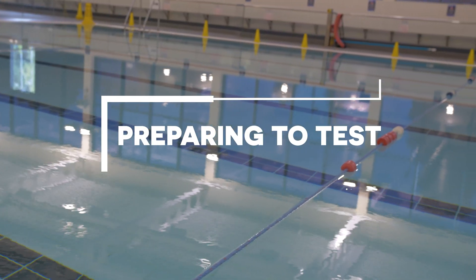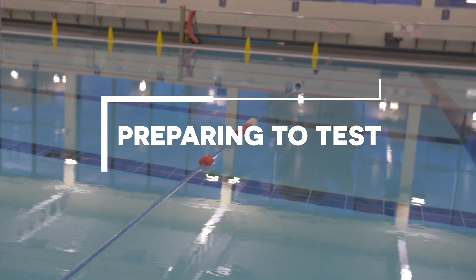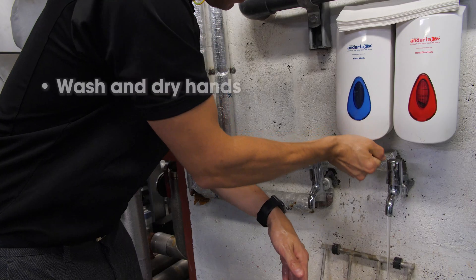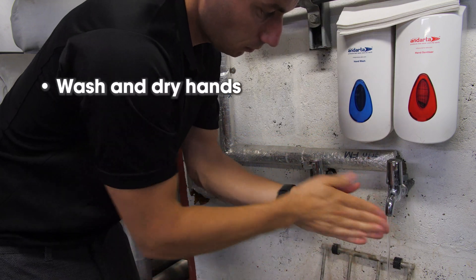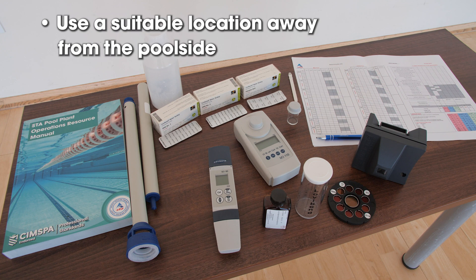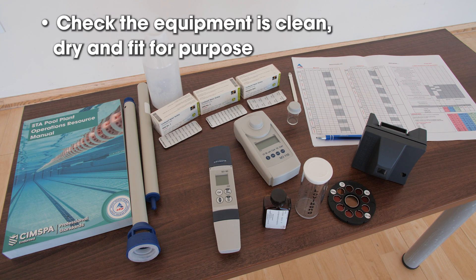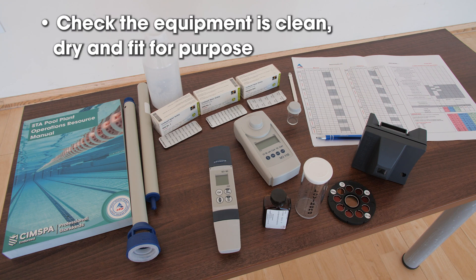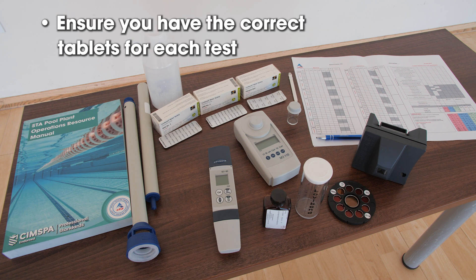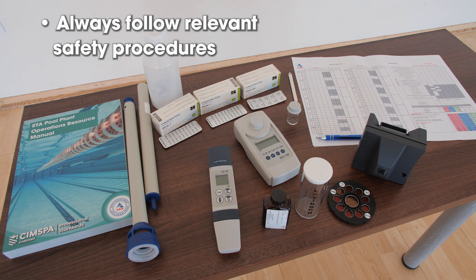To ensure you achieve accurate results, we recommend the following steps prior to testing: wash and dry hands, use a suitable location away from the poolside, check the equipment is clean, dry and fit for purpose, ensure you have the correct tablets for each test, and always follow relevant safety procedures.